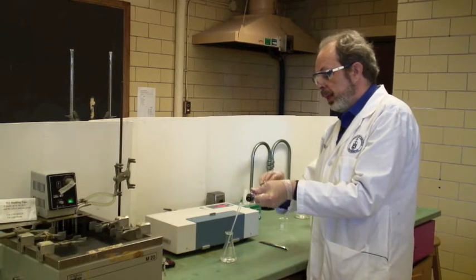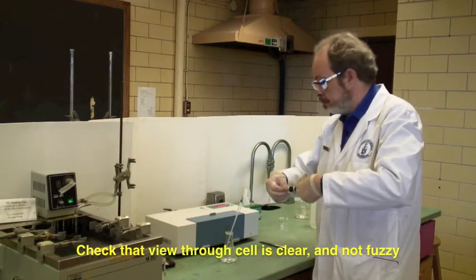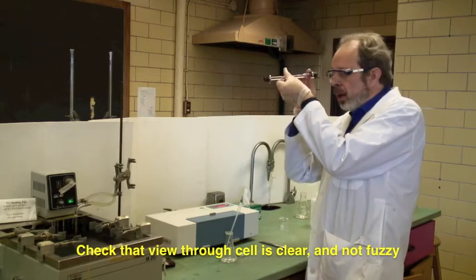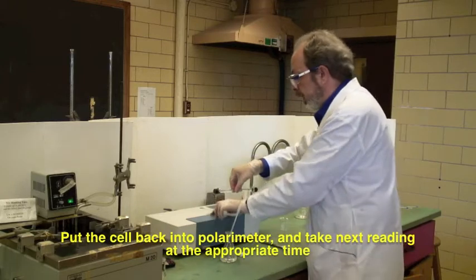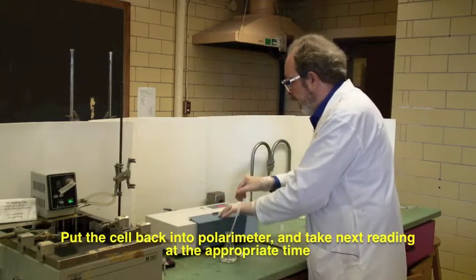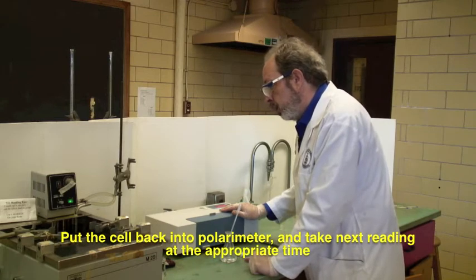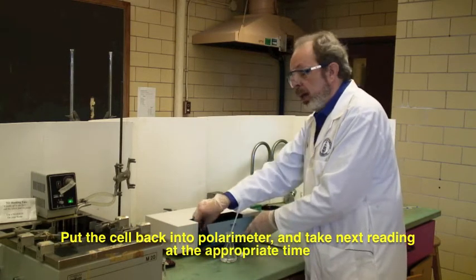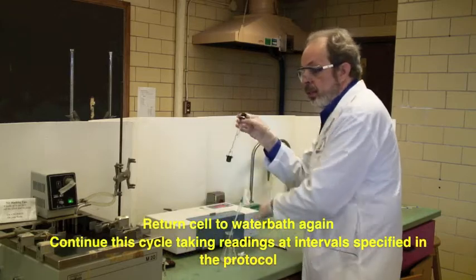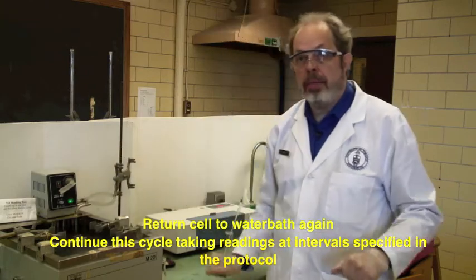You're not too worried about the middle. But do make sure that you dry both of these ends. Look through it. And I can see the brick pattern on the wall quite clearly. Pop it back in and at the appropriate time, take the reading and put it immediately back into the high temperature bath.